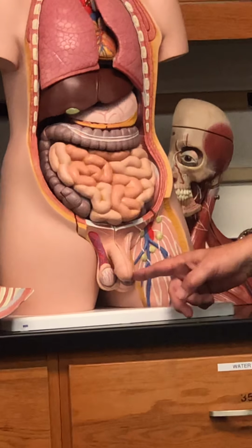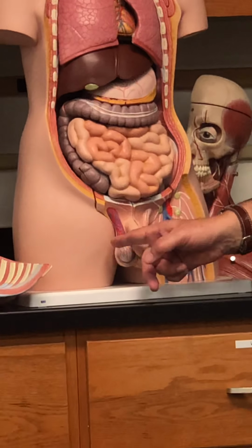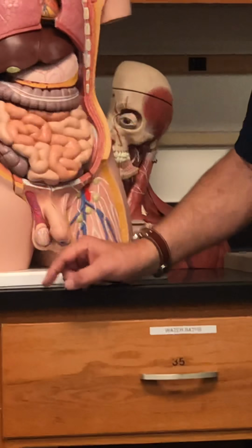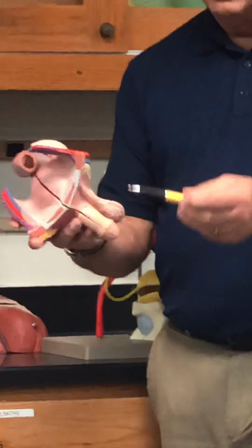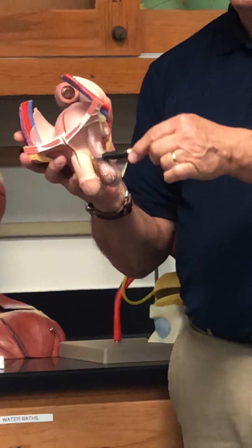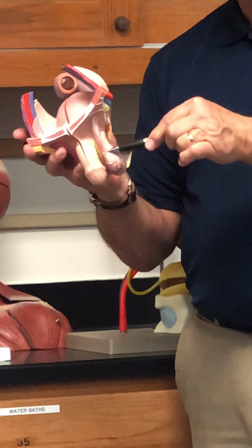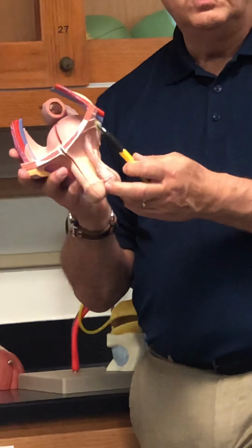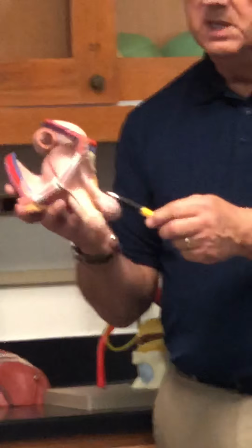Remember when the sperm is produced in the testes, it makes its way here into the head of the epididymis, and it goes down into the tail eventually. And then from the tail, right, it produces a tube. You can't really see it too well, but the tube comes up through the, what are these called? One here, there's one on the other side. See, it's filled with blood vessels, nerve fibers. It's called spermatic cords.